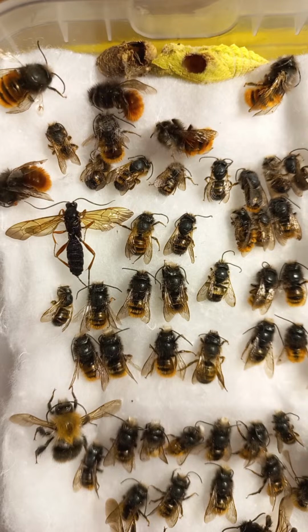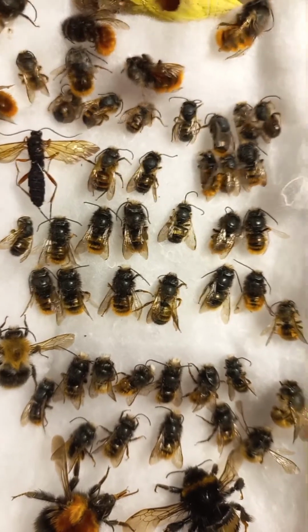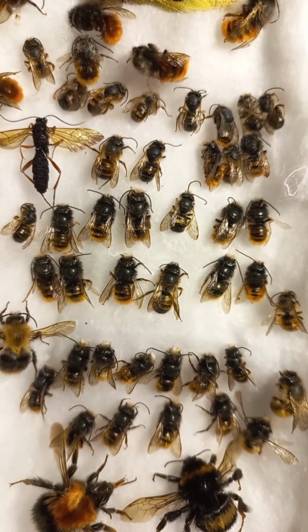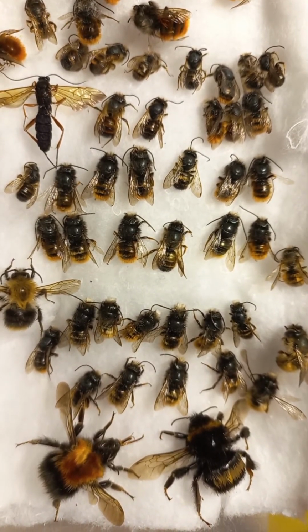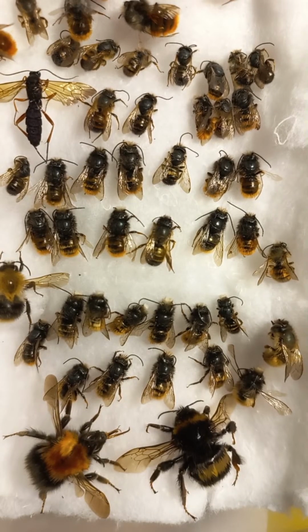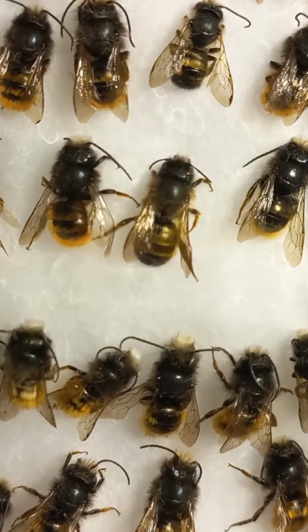So we're observing now lovely mason bees. They're also not very aggressive, they're very polite, very cute. Especially males, they have no stinging apparatus, but females are not inclined to sting either. Bumblebees are also quite polite. The majority of bees here are mason bees or leafcutter bees of the family Megachilidae.